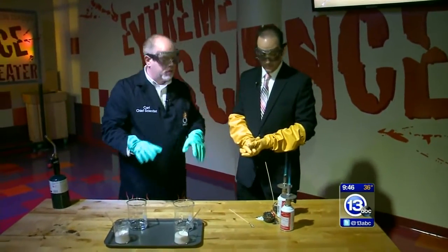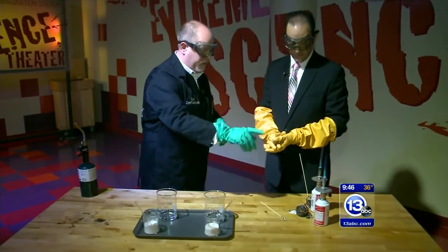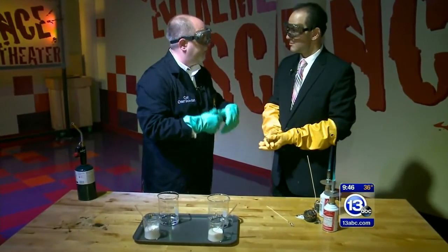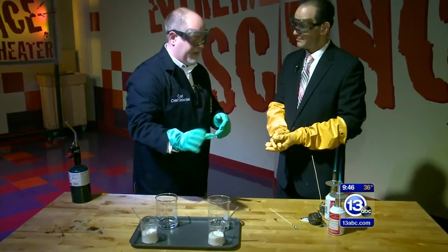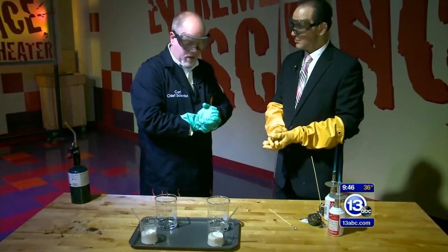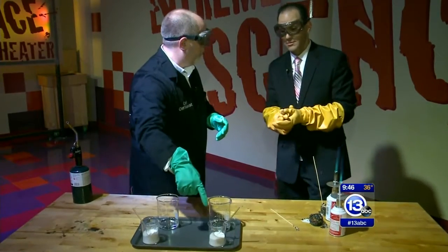Let's move away from that and we're going to head straight towards sugar. We're going to talk about taking away those amino acids that were in there that caused the Maillard reaction that created all the flavorful compounds. I've got concentrated sulfuric acid here — this is 18 molar, it's very concentrated. We're going to do a reaction between that and this sucrose, or this sugar.